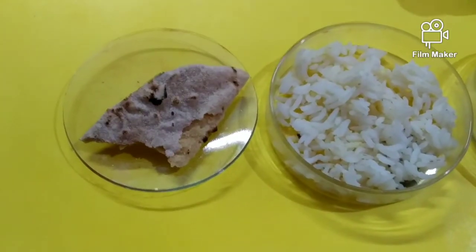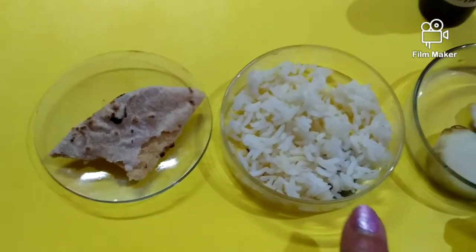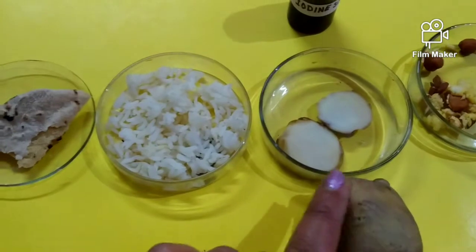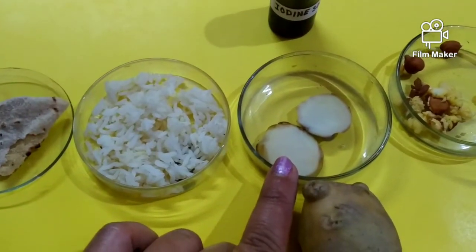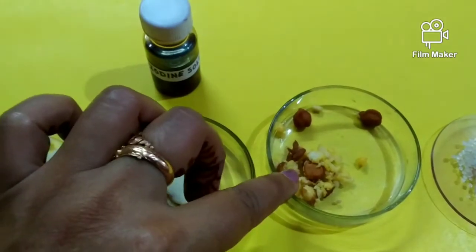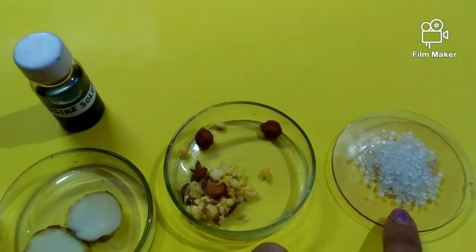Okay, let's start. The food samples taken are: first, chapati; second, boiled rice; potato slices; crushed gram seeds which were soaked overnight; and next, sugar crystals.